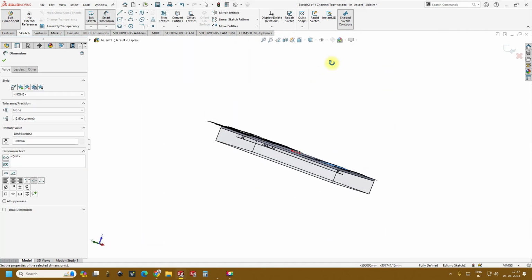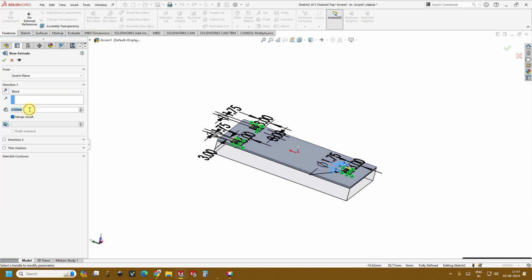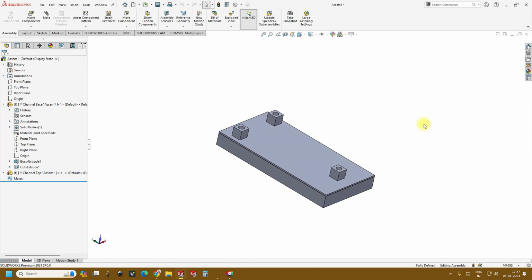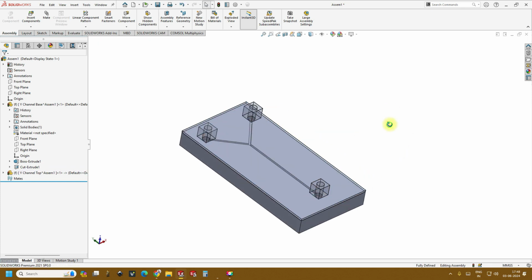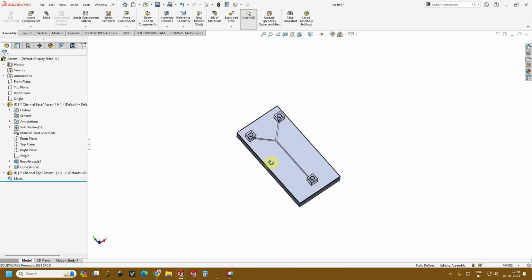So once it is done, go back to features, extrude. This again you can extrude to 3 mm. So finally you can see a complete microfluidic device, and if we just make it transparent, you can see internally it has a microfluidic channel.